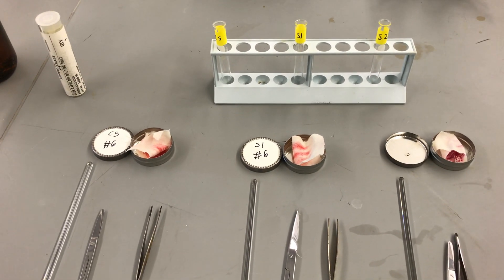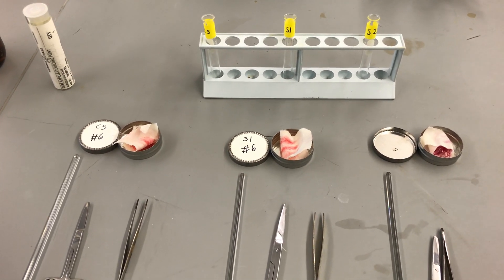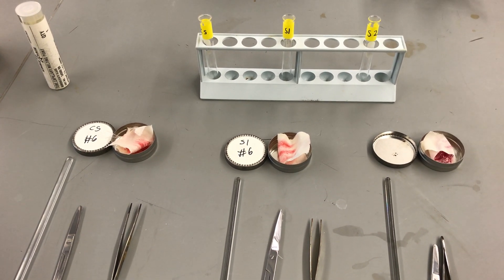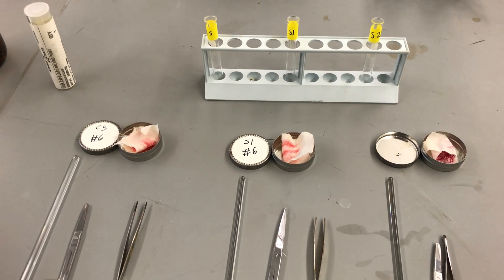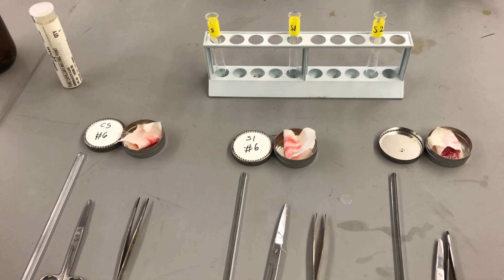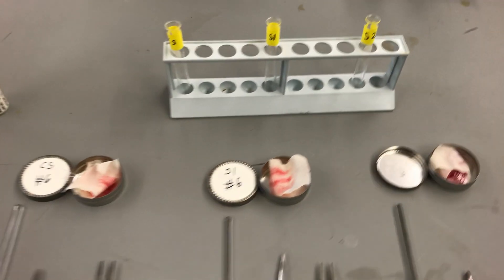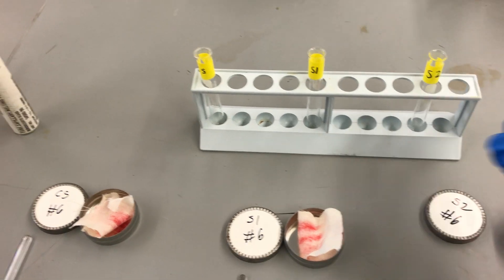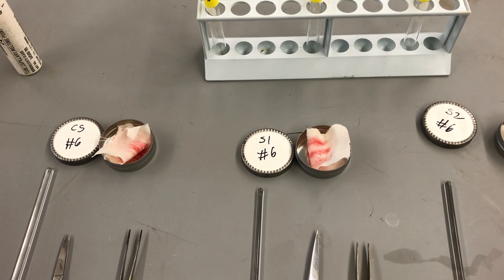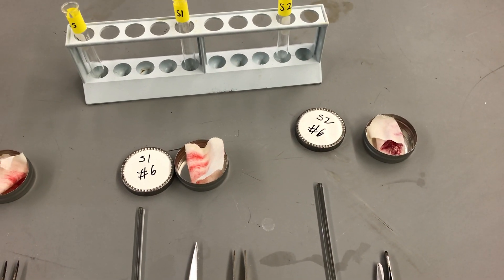Ladies and gentlemen, welcome to the thin layer chromatography lab. This is one technique we can use to analyze organic evidence — any evidence that essentially contains carbon and hydrogen bound together in some form. We have three samples today: a crime scene sample, a suspect one, and a suspect two sample. Each sample contains a lipstick stain on a napkin — one taken from the crime scene, the other two taken from our two main suspects in the murder.